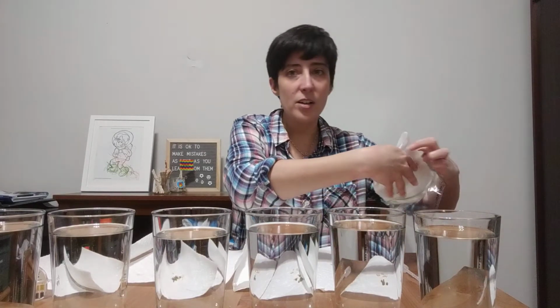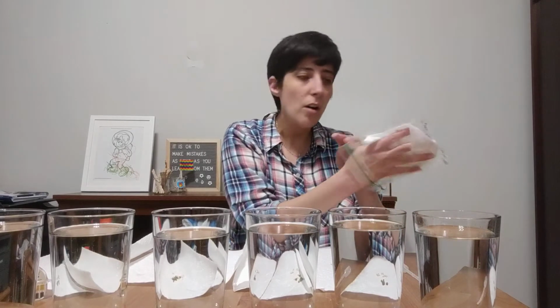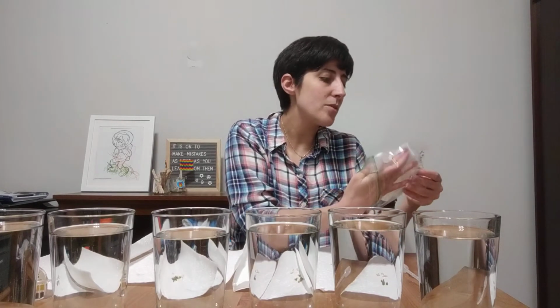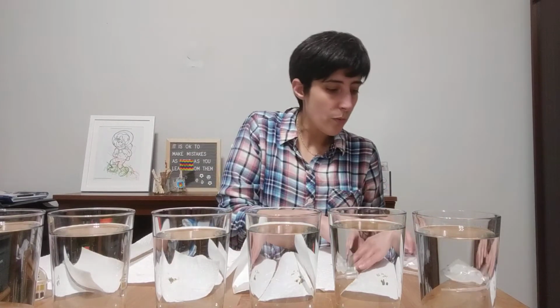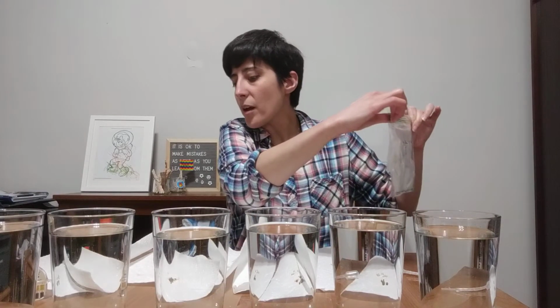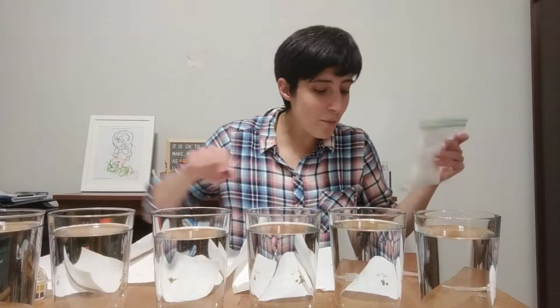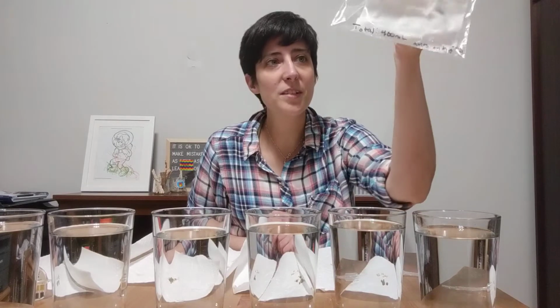Now, as I'm doing this, I'm being very careful. I know it's kind of hard to see through all the glasses, but I'm being very careful not to get water on the other paper towels that I have here, because we don't want to change the pH. So I want to be very careful, keep those separate. I'm checking to make sure that, yeah, the drip before got right in front of this paper towel, so it looks like I'm good. I don't have to run and get a new one, which is great. All right, so this one's 0 mLs.